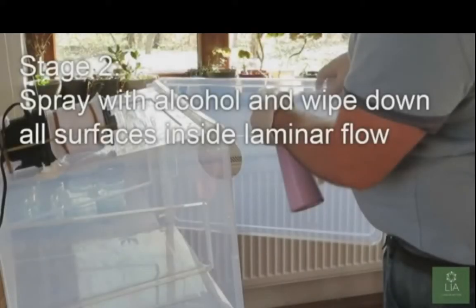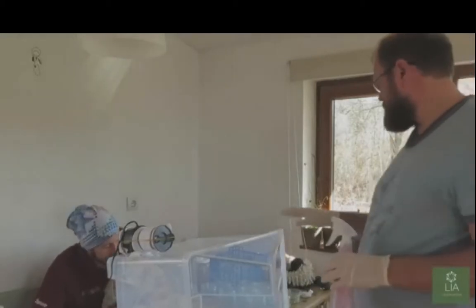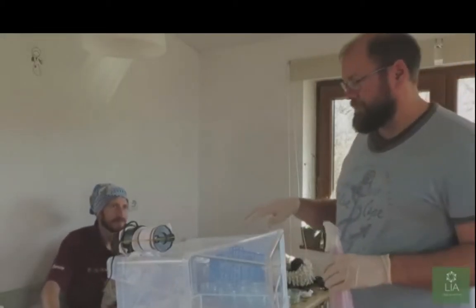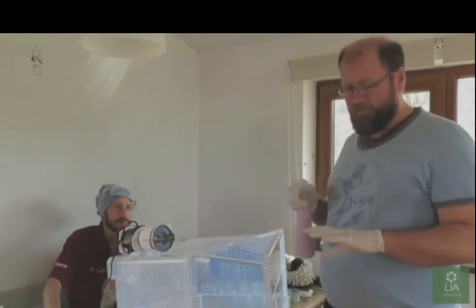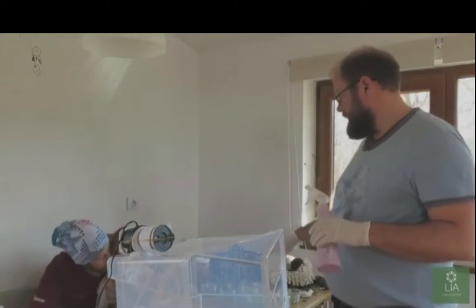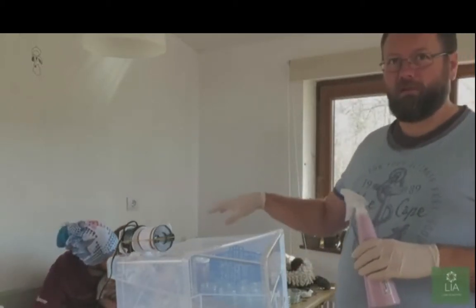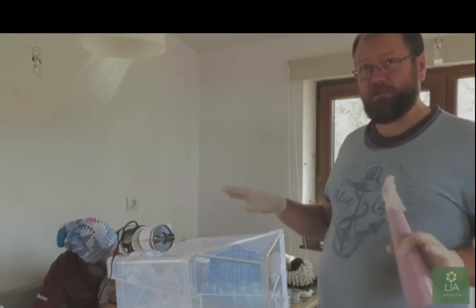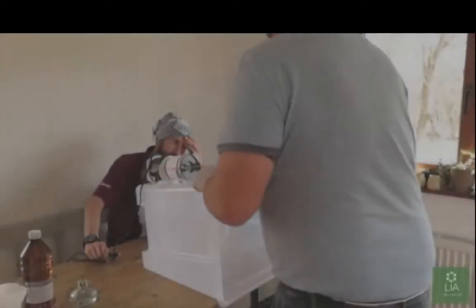Spray with alcohol and wipe down all surfaces inside the laminar flow. I do not have a flow hood. That's why I'm using a clear container, though you can't see very well through that. Before we get started pouring the agar into the Petri dishes, we're going to wipe everything down, arms, gloves, and then before we transport the dishes in, we will clean all the dishes before putting them into the environment, so everything is absolutely clean. So he's improving his sterilization technique as he goes along here.